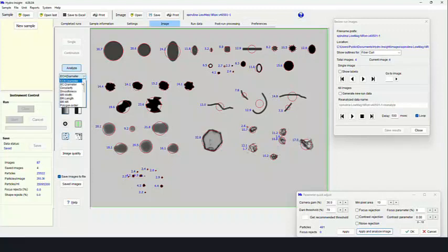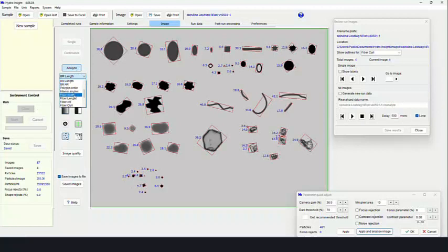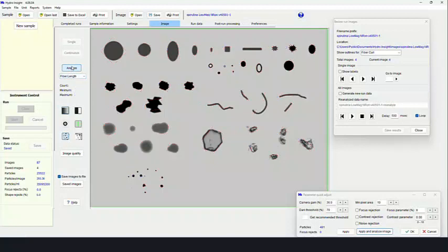When it comes to fibers, some of the better measures to use are things such as bounding rectangle measurements, where you can get aspect ratios, which are a lot more relevant for fibers. You could also look at length, width, and aspect ratios. There are also Feret measurements, and there's also fiber measurements. So we can actually take a fiber that might be curved, and we can tell you, for example, what the width of that fiber is. When we straighten it out, we'll tell you what the length is. And we can also tell you what the aspect ratio is as well.